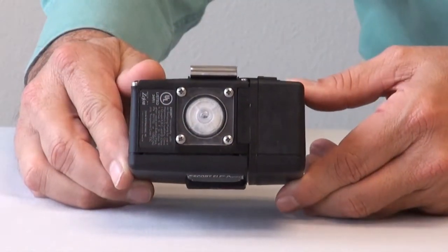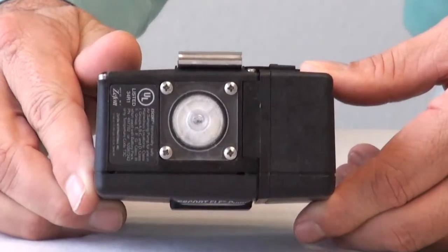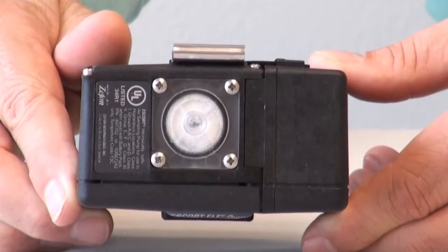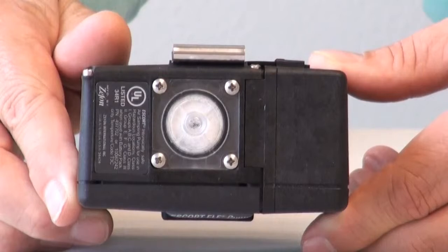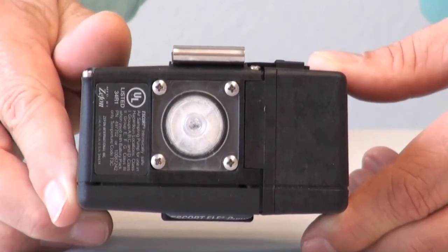Before you begin any sampling, you need to check the inlet dust filter. If the filter becomes clogged, the sample flow might be blocked or an extra load is placed on the motor and reduces the operating time. Start with a visual inspection of the filter. If the filter is discolored, it needs to be replaced.